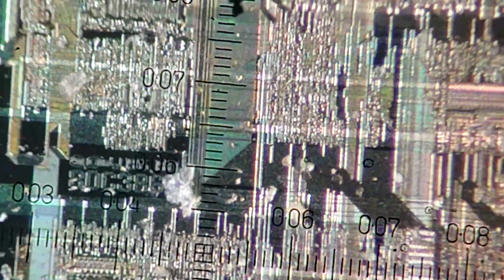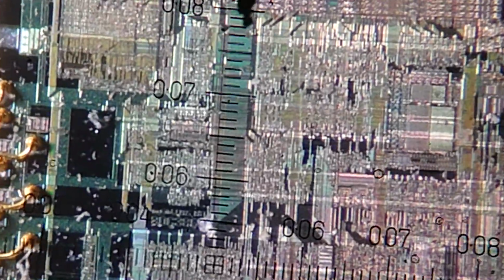the Olympus SZ-6045. So again, that was our right channel. We need to look at how it changes magnification here. Yes, let's see how it works. We don't see loss of focus on the right channel and little loss of focus on the left channel. That's all that's left for me to fix.